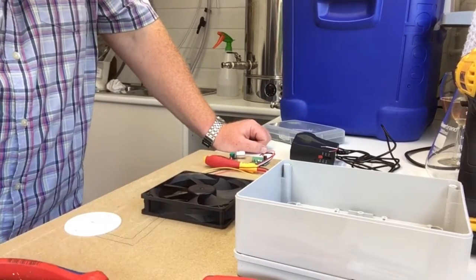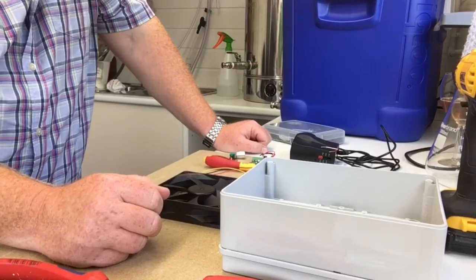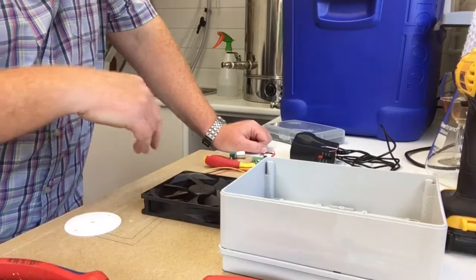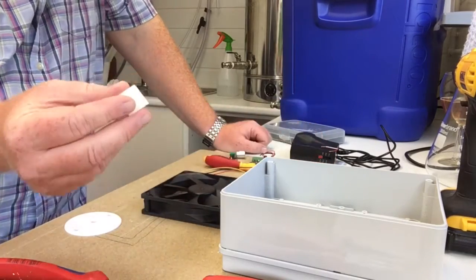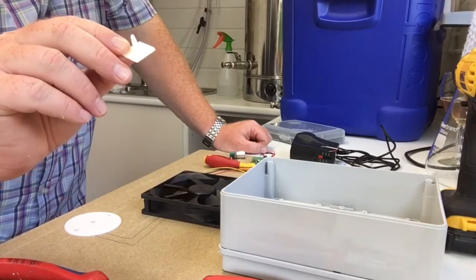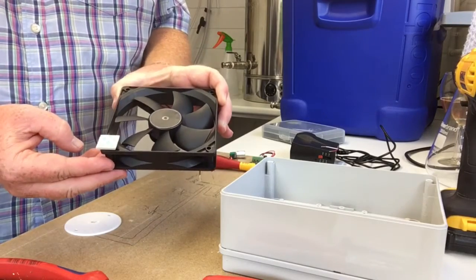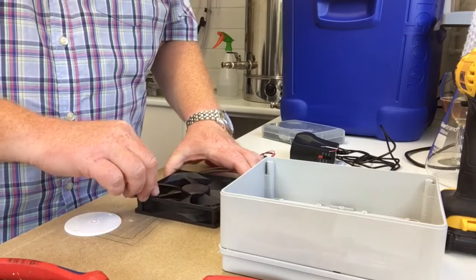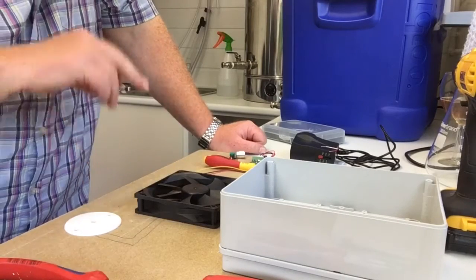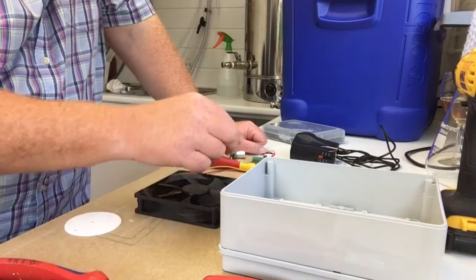What am I going to do? How am I going to mount it? Well, I'm kind of not reinventing the wheel, because I've seen a few videos and watched how people are doing this, but I'm not going to go with a nuts and bolts idea. I'm just going to make life a little bit easier for me, because what I've got is these little PCB mounts. I've got stacks of them, and they just so happen to fit into there nice and snugly. So what I intend doing is using some Grip Fill, you know, the stuff, no nails or similar, and bond those in each four corner.